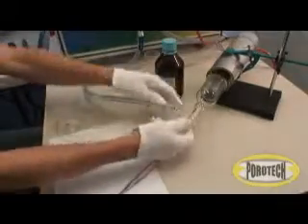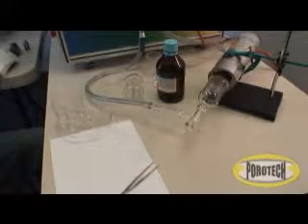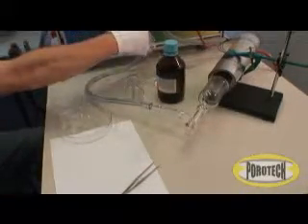After 1 to 2 hours of drying, depending on the material and temperature, the heated vacuum chamber is opened and the tray is removed.